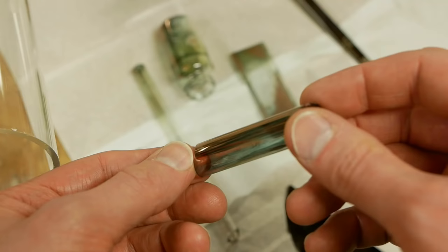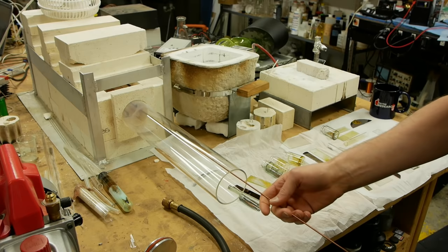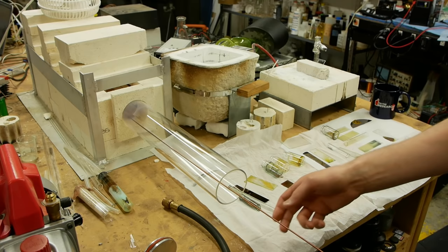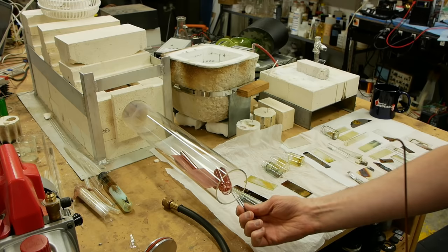Let's open up the furnace here and see what we got. This is the first time I've looked in here that's been running overnight. One of the features of atomic layer deposition is that it's very slow. So this has been running overnight. All right, looks like we've got some decent stuff here. I'm very happy. This is the first time I've seen it. And I am going to touch it with my hands. Let's see what we've got here. Nice.